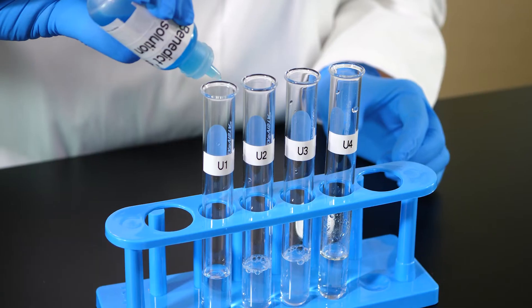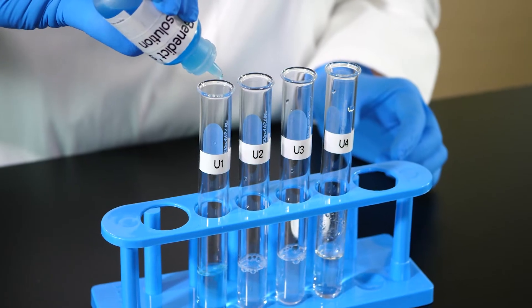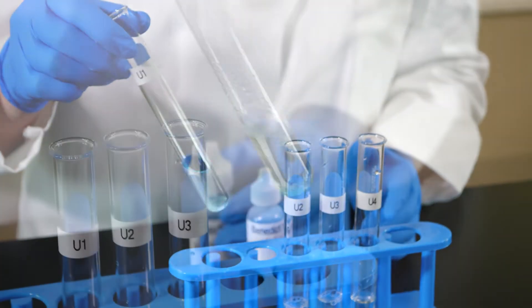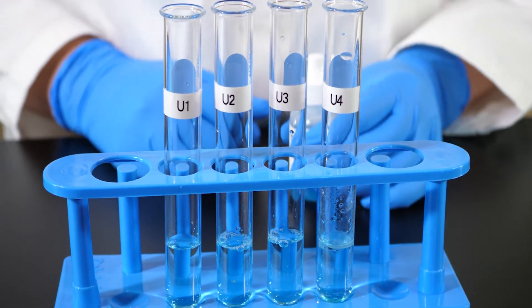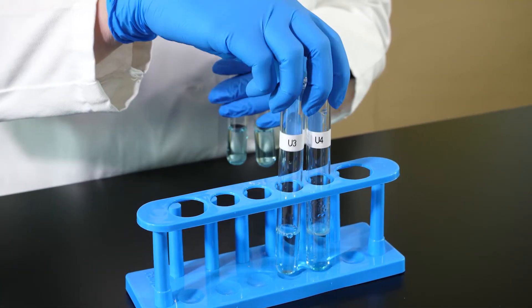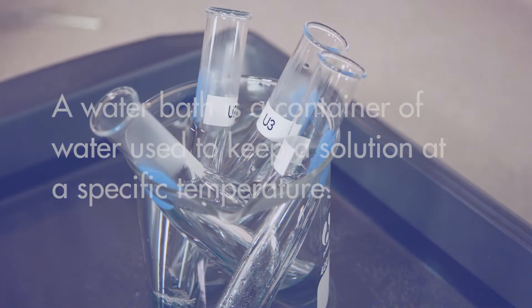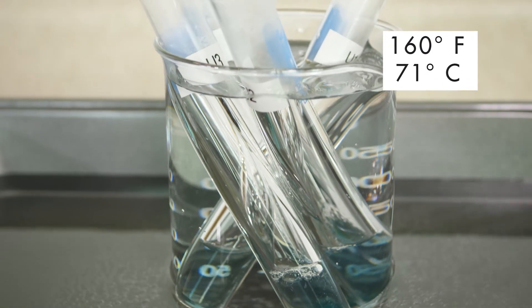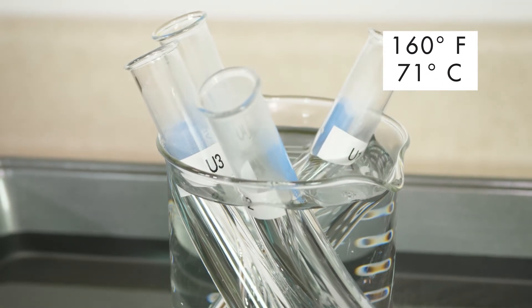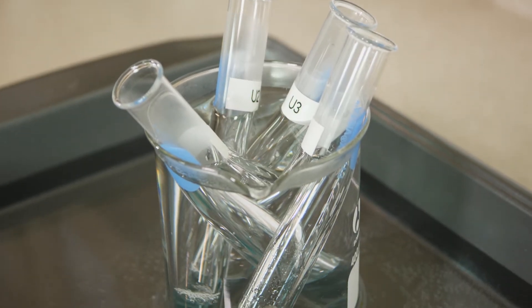We add 10 drops of Benedict's solution to a sample of each of the unknown solutions. After adding the indicator, we swirl each test tube for a few seconds to mix the contents. To speed up the reaction of glucose with Benedict's solution, we need to place the test tubes in a water bath. A water bath is a container of water used to keep a solution at a specific temperature. This water bath has been heated to 160 degrees Fahrenheit, or 71 degrees Celsius. The test tubes need to stay in the water bath for 10 minutes.